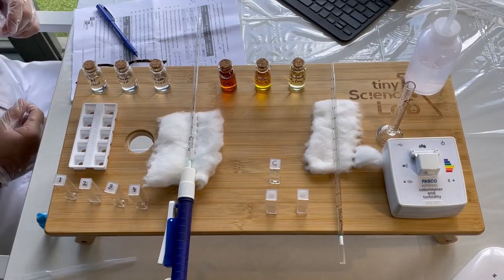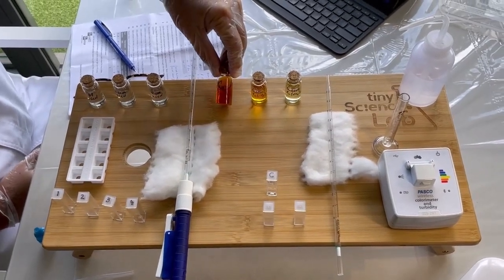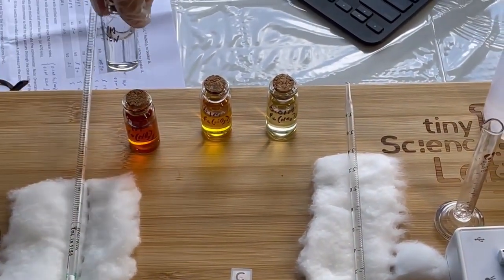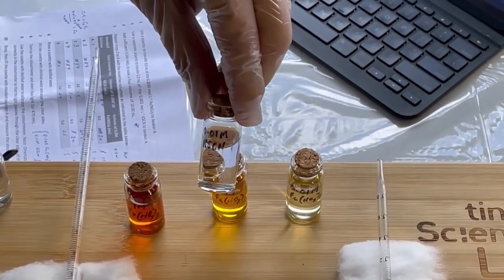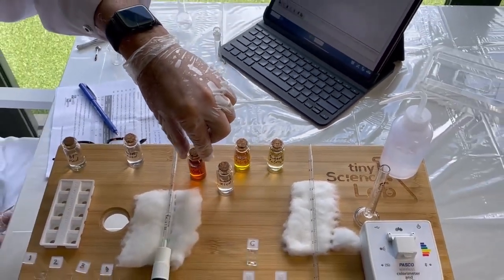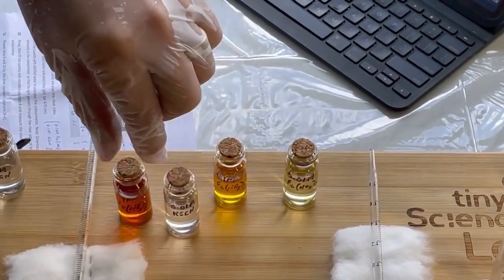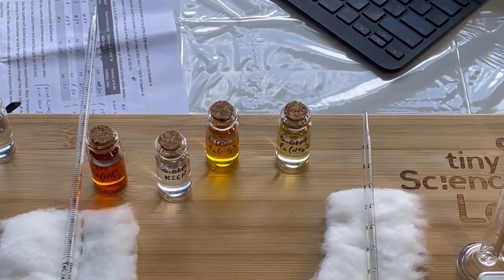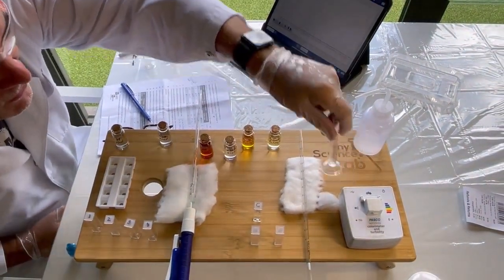which in this case is iron thiocyanate. So I'm going to be starting with a 1 molar solution of iron nitrate. So you can see the color is quite dark. And I'm going to be mixing that with a 0.01 molar solution of potassium thiocyanate. So with these two together, hopefully this one is a 100 times more concentrated solution than this one. And so hopefully that will push the equilibrium far enough that we will effectively have pushed it right to the edge. So I'm going to get my measuring cylinder out.